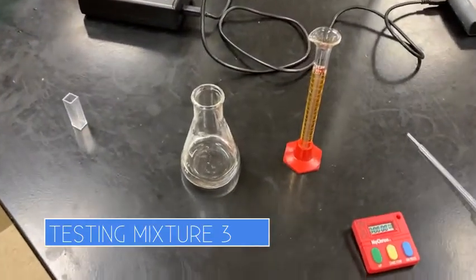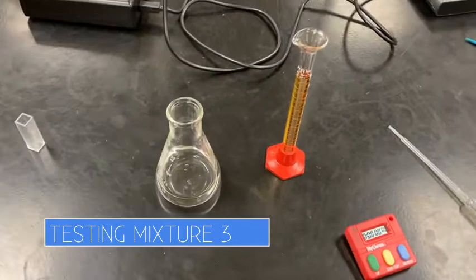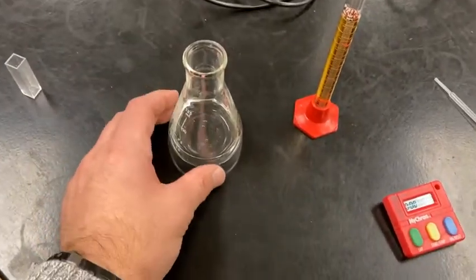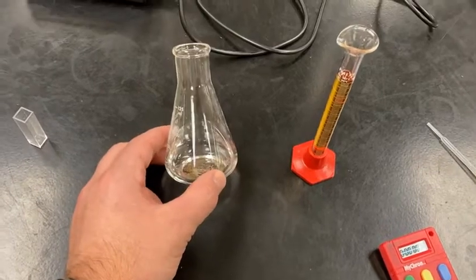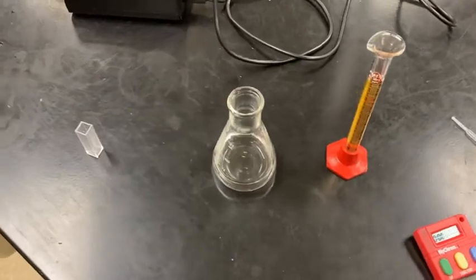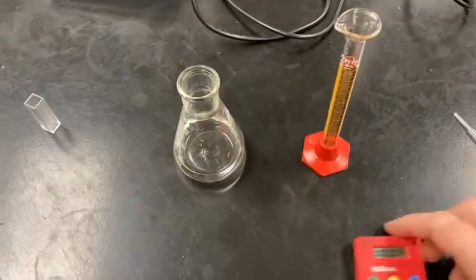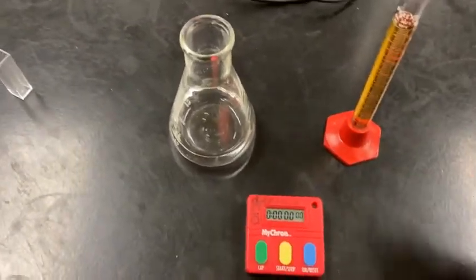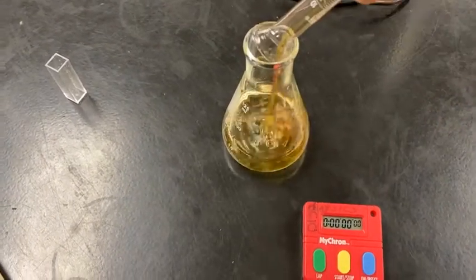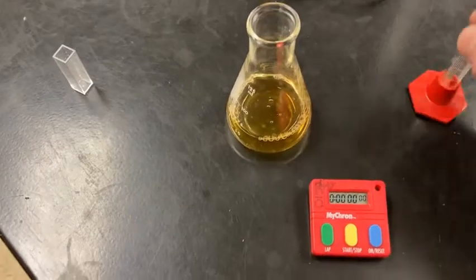All right, I've got mixture 3 all set up. Everything in this mixture is 10 milliliters except for the HCl. HCl, we added 20 milliliters. So I've got that in here, all mixed together, the water, the acetone, the HCl. All I have to do again is add the iodine, and we run it. So add the iodine here. Start my stopwatch.